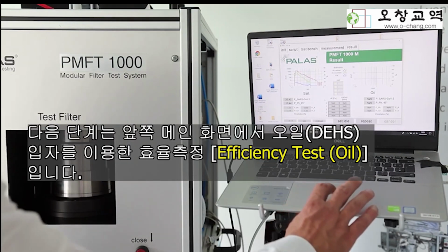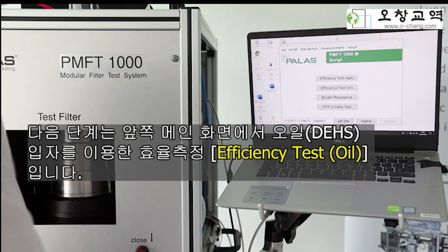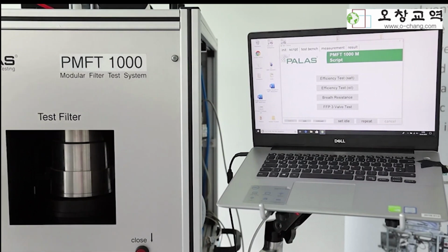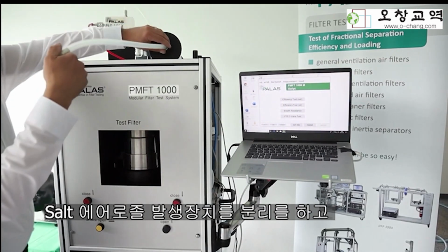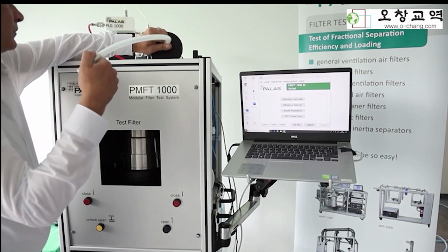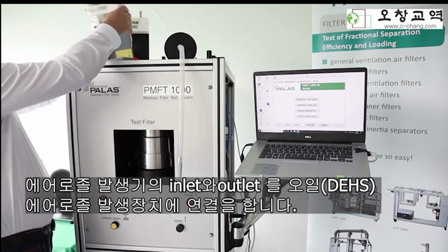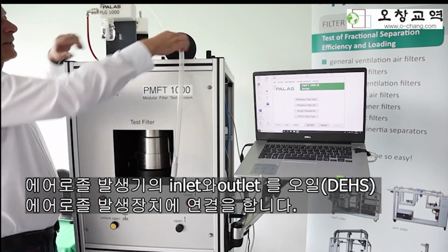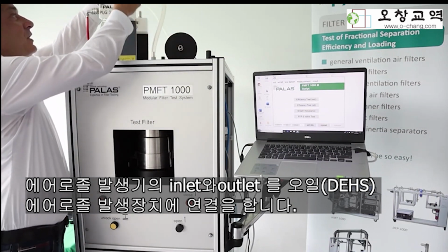Next step is to move forward again to the scripts, and we can start the efficiency test with oil. To do so, I disconnect now the salt generation, and connect the inlet to the outlet of the oil generation.